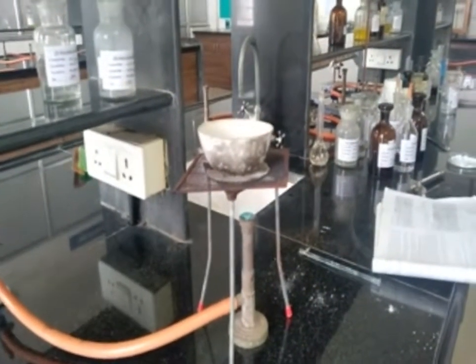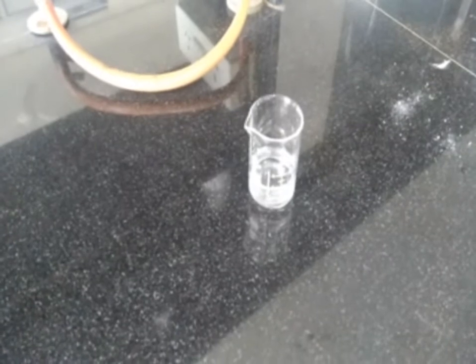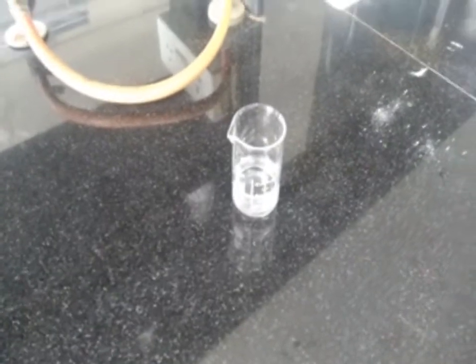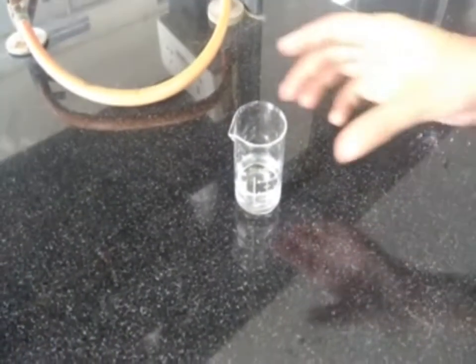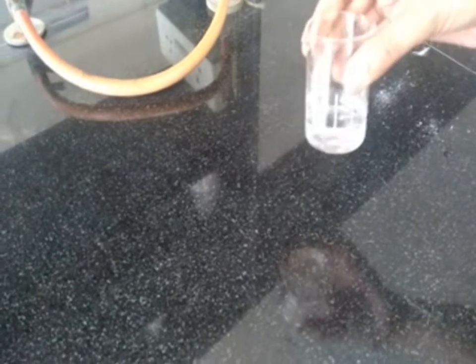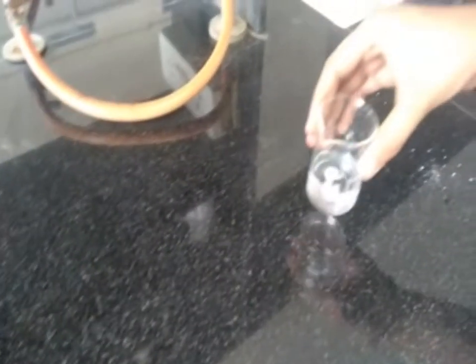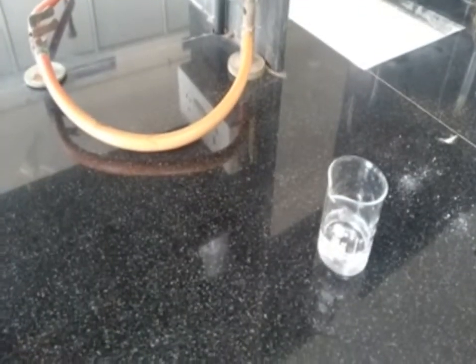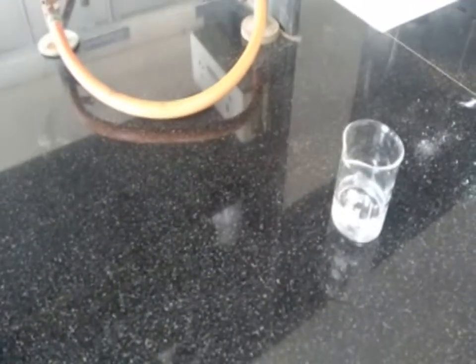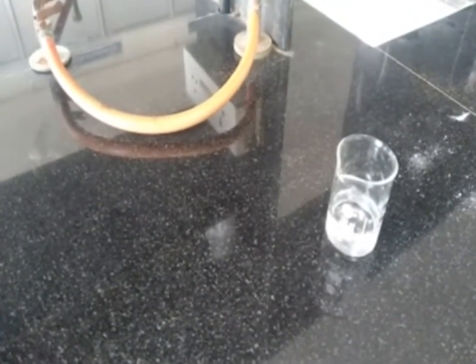After boiling the mixture for 10 minutes, we filter the solution. This filtrate is known as the sodium fusion extract, and it is used for detection of nitrogen, sulfur, and halogen. Let's start with the actual procedure for determining each element.